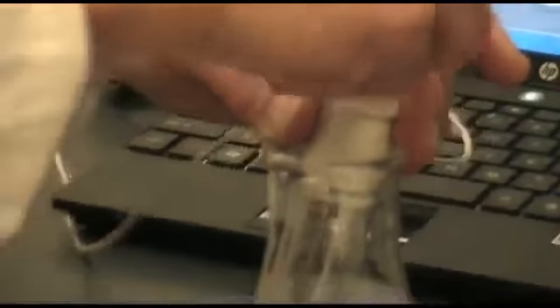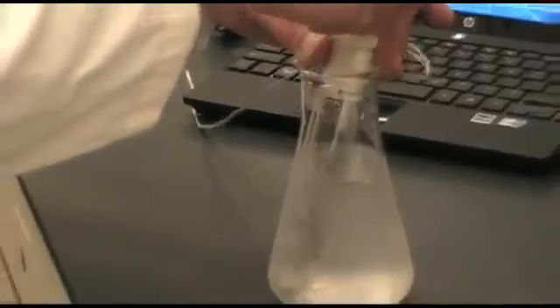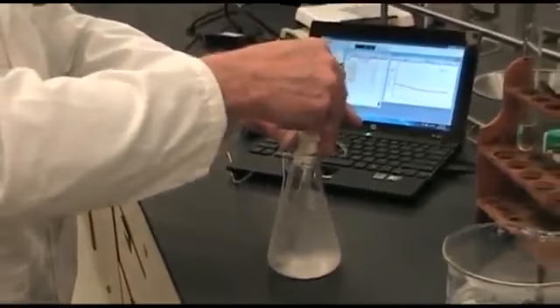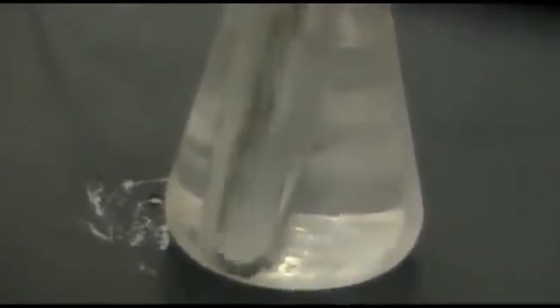And I think I'm going to continue to stir it until it comes back down, until we get a freezing constant temperature. So you see now that it's going down because I can't keep up with the cooling process. Okay, so you can see that it's slushy right now, and the temperature is fairly constant there on the screen at -3.9. And I'll keep stirring it for a few more minutes so that we get a good freezing point.